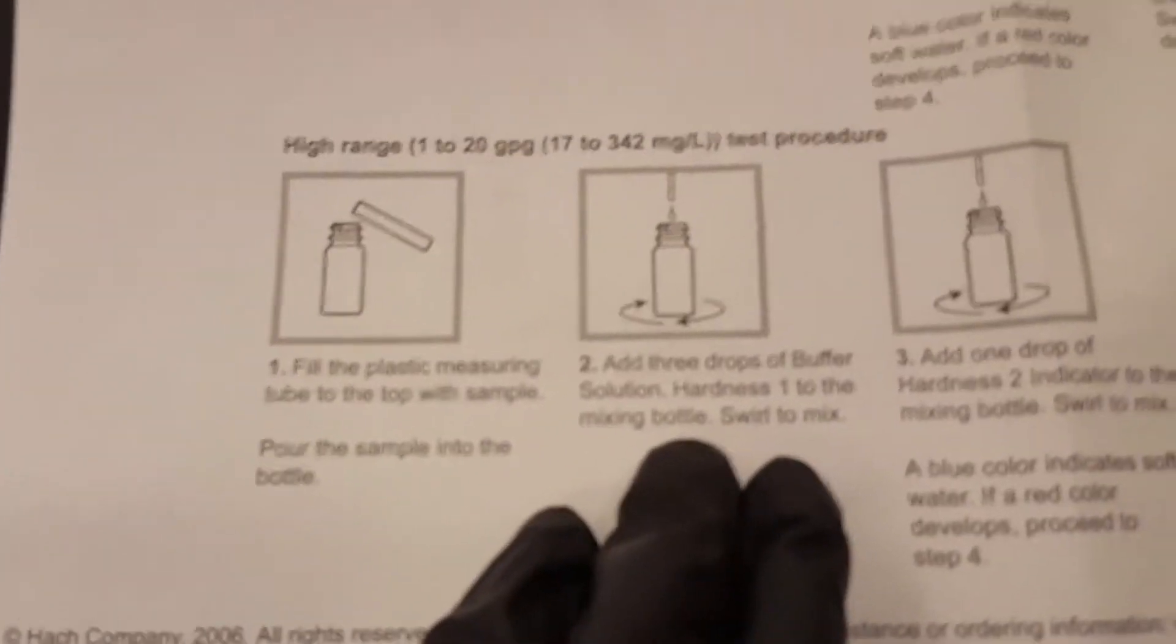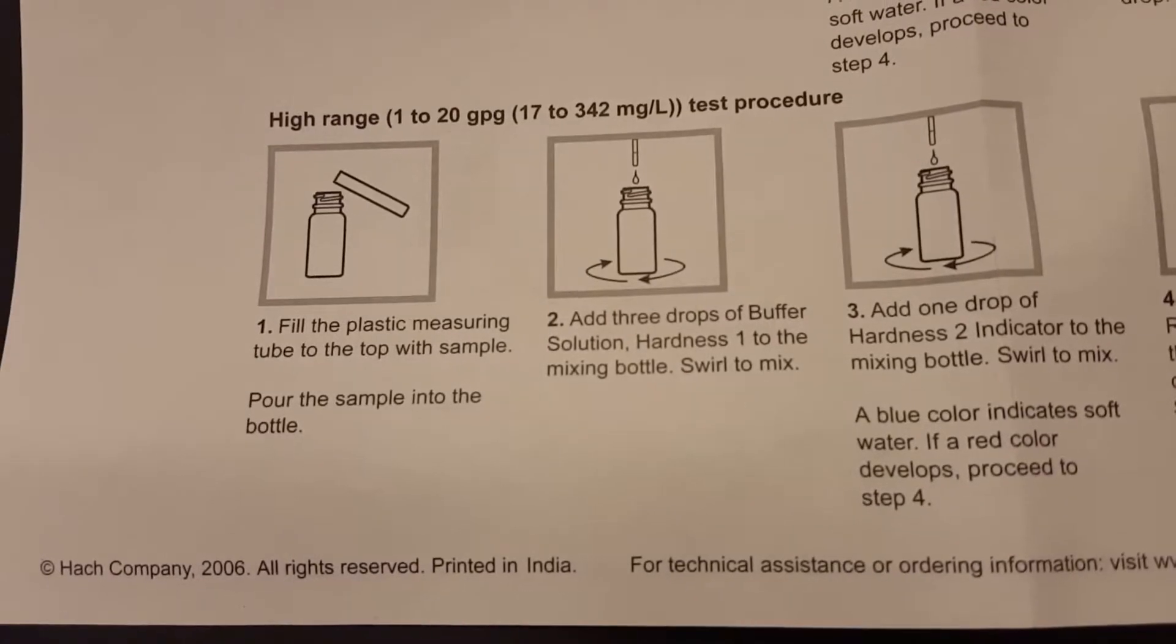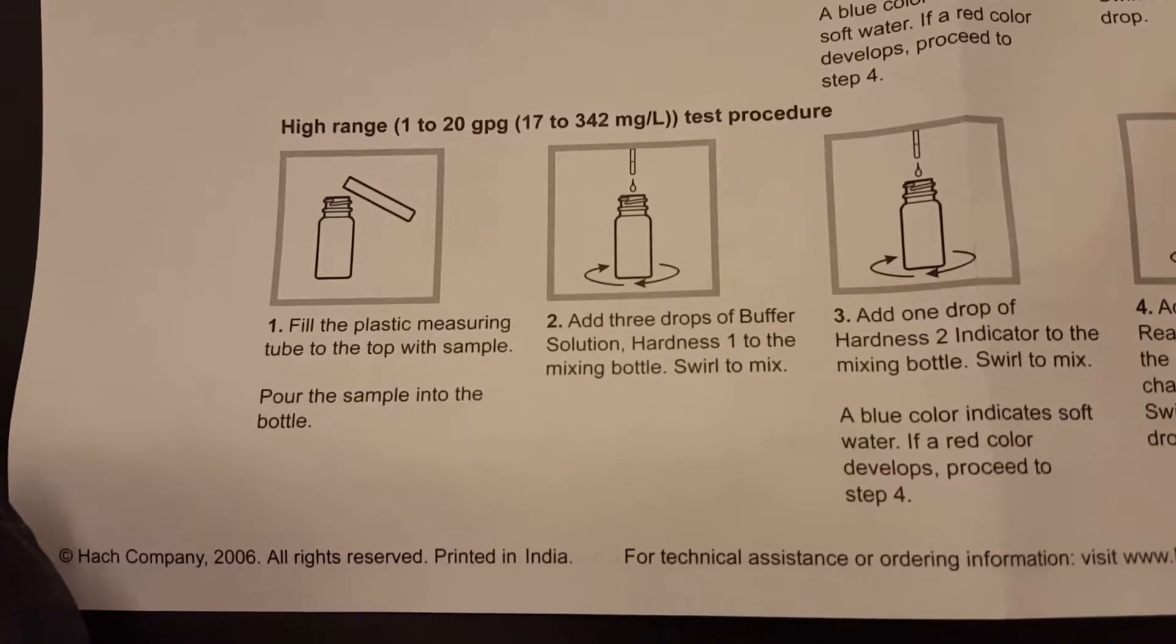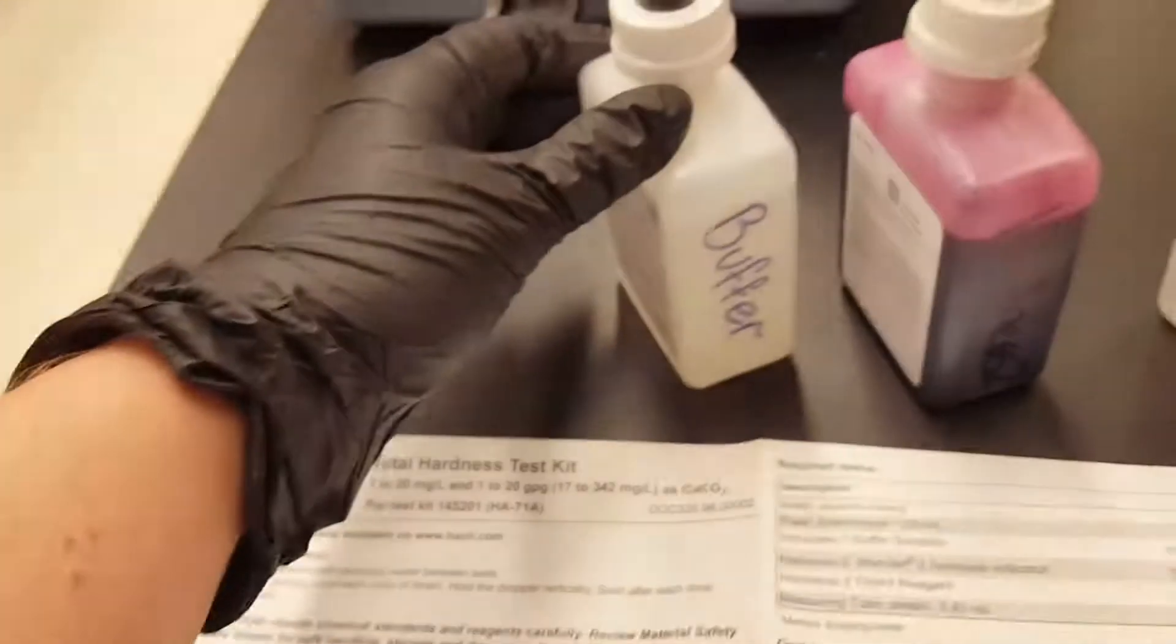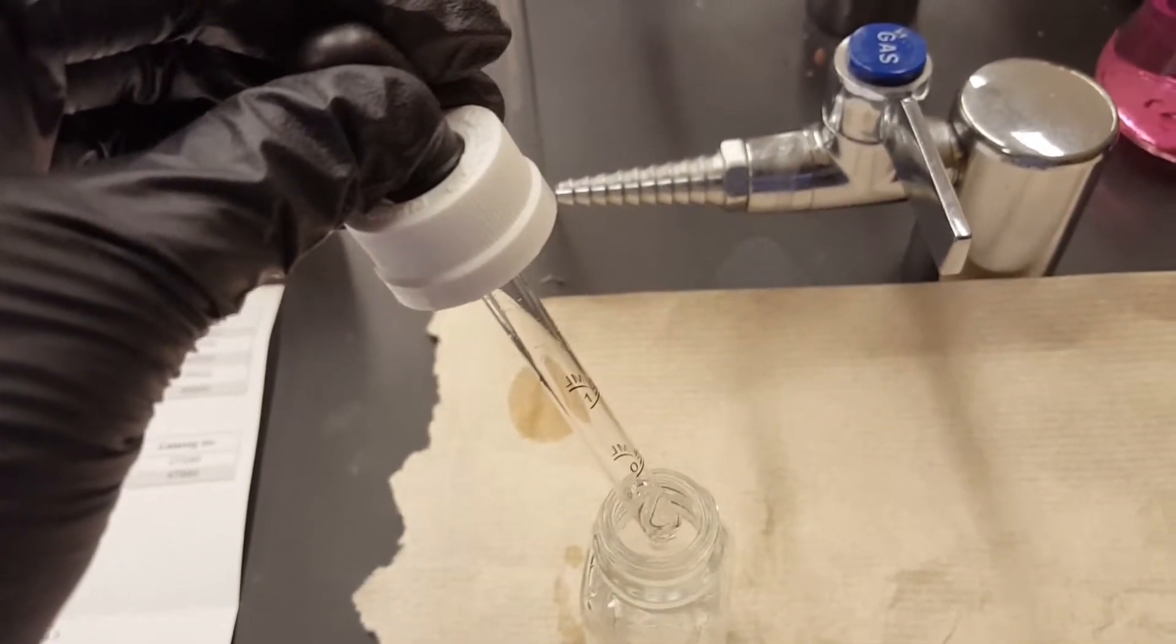And then you're going to add three drops of buffer solution. Again I've already labeled it so we're going to add three drops. Two, three. Three drops of buffer solution. Swirl it to mix.